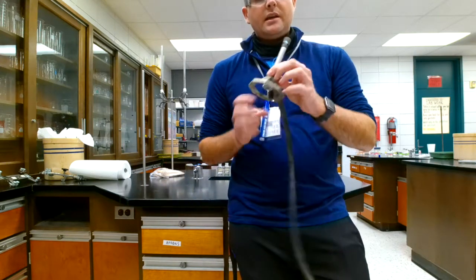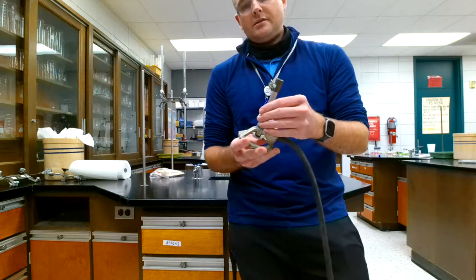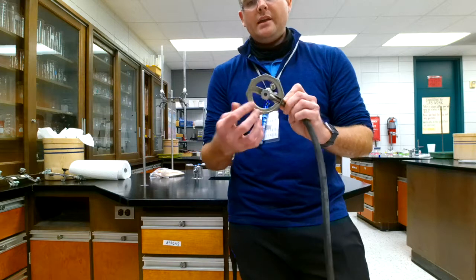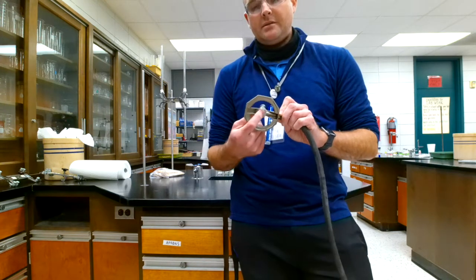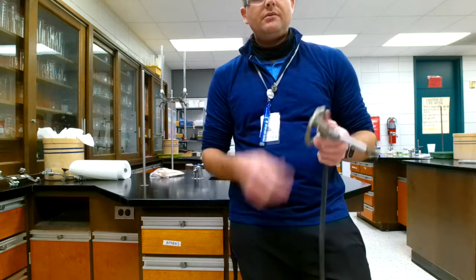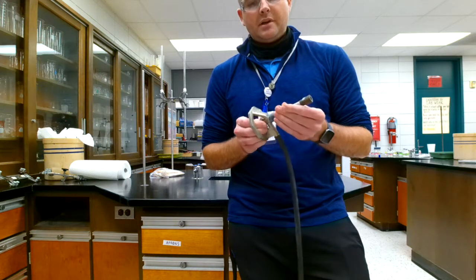And then we'll take a look at the Bunsen burner itself. So here, I just lit it, and it's still quite cool on top. So that's what's so great about it. Now the barrel turns here, and then the valve turns here. So the valve controls how much hydrocarbon, or how much gas is coming into the Bunsen burner. Now the barrel controls how much oxygen there is, because you need two things to make a flame. You need your fuel, and you need your oxygen. So this is to get the right mixture. So you'll see what I mean in a second whenever we light it, when we're getting the wrong mixture.